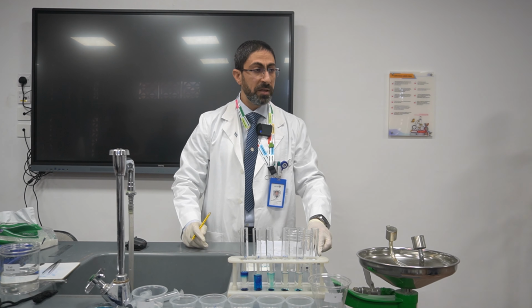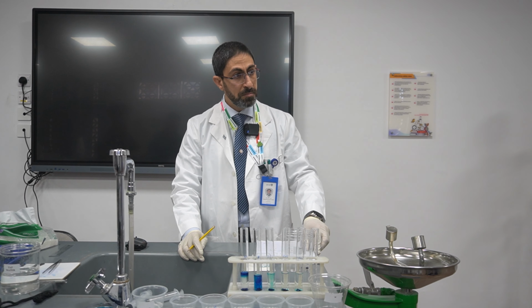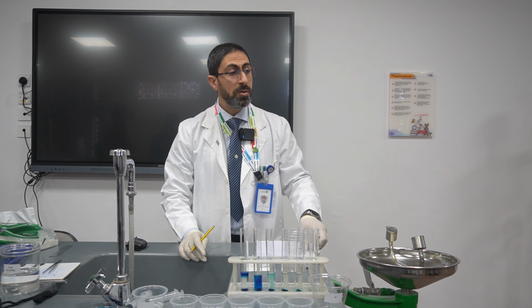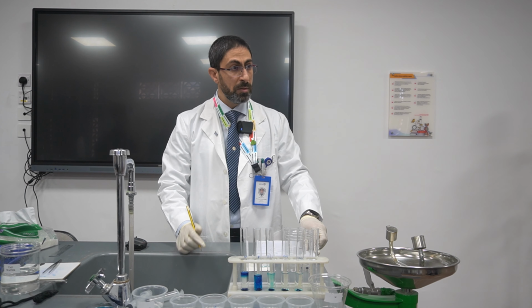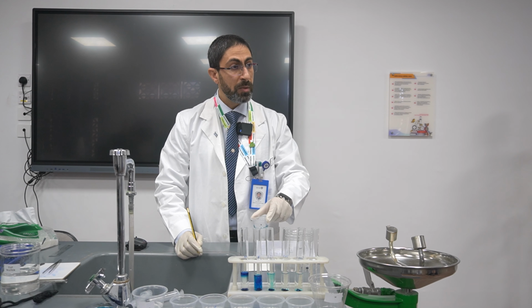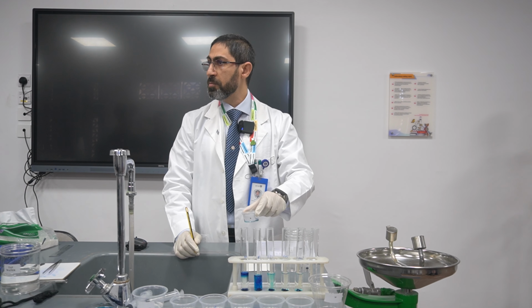Any one of you has any explanation for this? Can I guess? Yes. Is it that there's no salt atom which doesn't break down, so the water moves slower? The net movement of water is slower. Actually, does anyone have any objections about this?